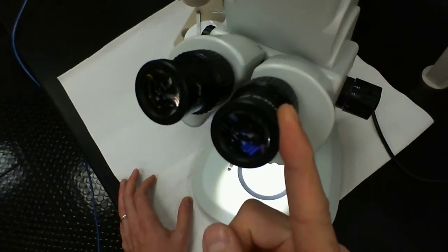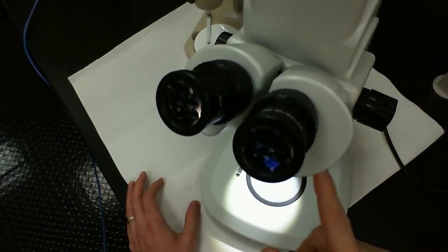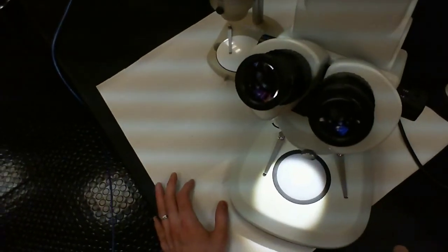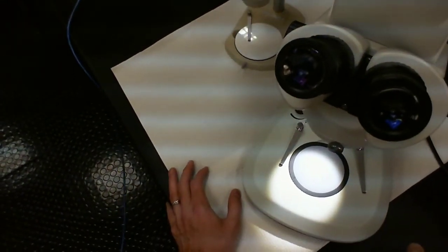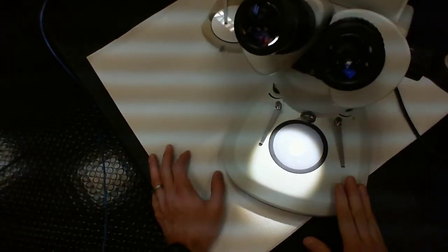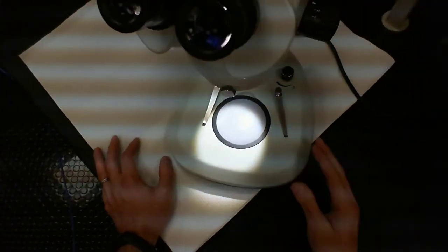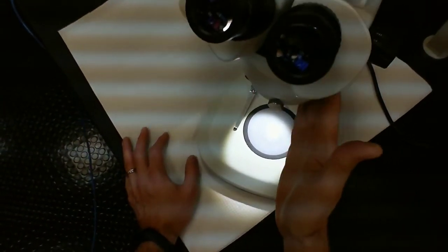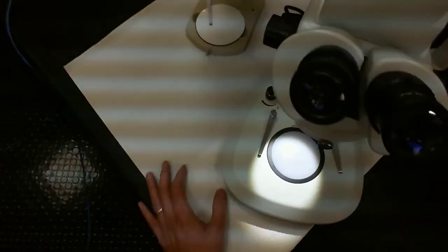We're looking at about 45x magnification in total at the highest magnification for this, versus 1000x magnification for our typical compound light microscope. Magnification is much lower, which is why you don't need a fine focus knob here. You just have a coarse focus. Again, you have an adjustment knob here that will adjust your magnification from the objective lens.